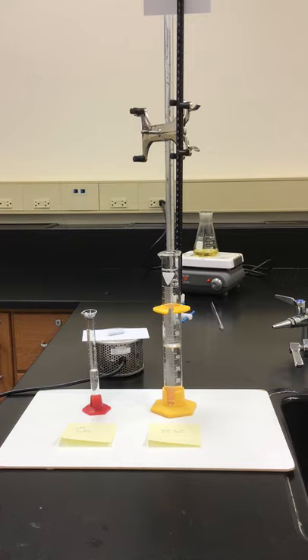In the background you can see my flask is boiling. We're going to be titrating with that flask in just a second. What's going on inside that flask is we're taking hydroxylamine, reacting it with some iron three chloride. During the course of the reaction, the iron three ion turns into an iron two ion.